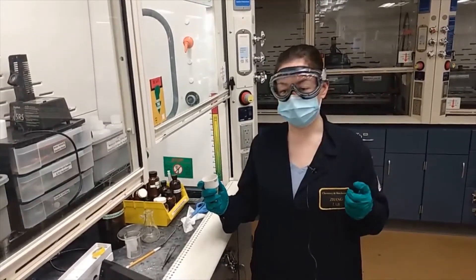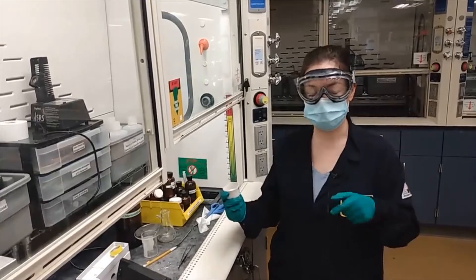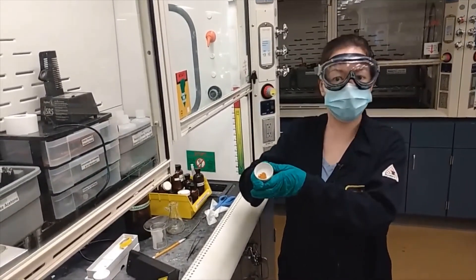Then we'll get this nice orange solid. We can filter it, wash it with a little cold water, and let it air dry to get an orange solid.